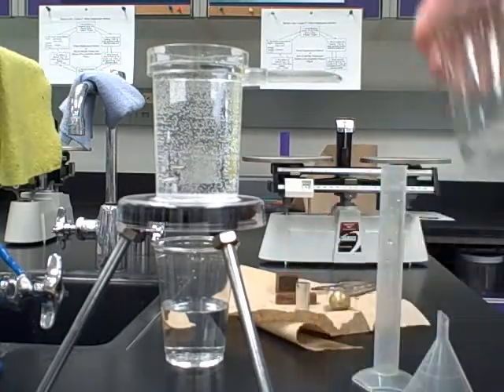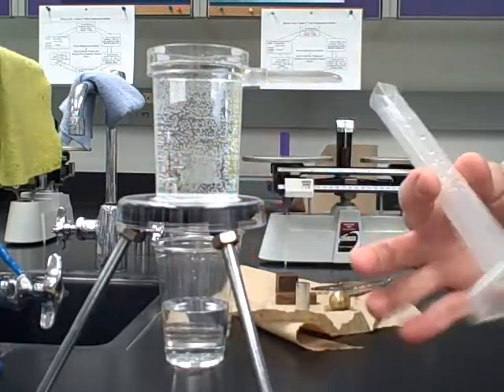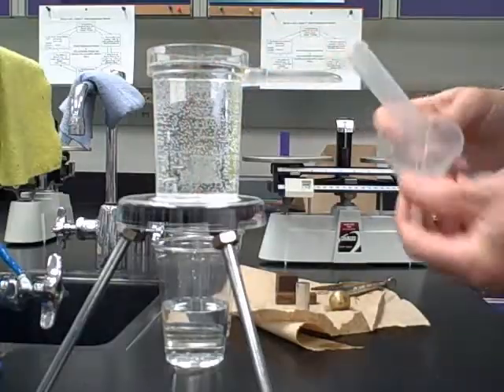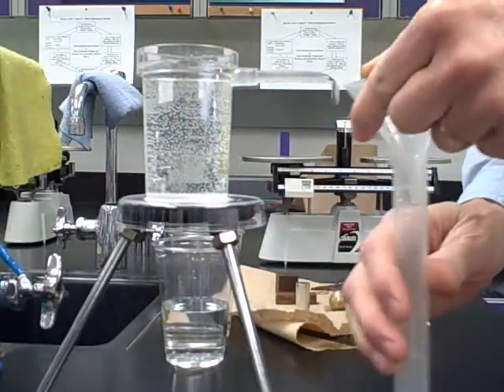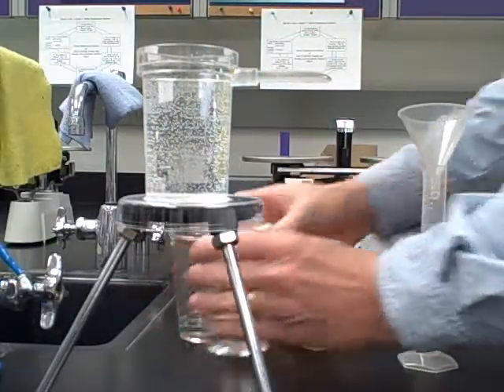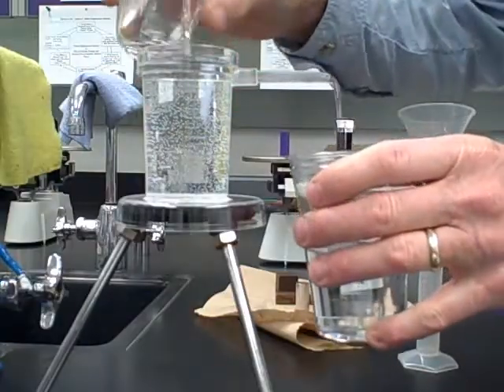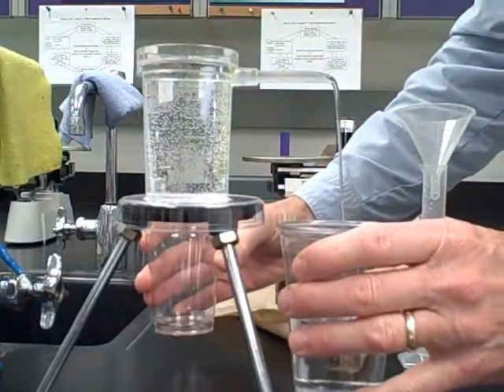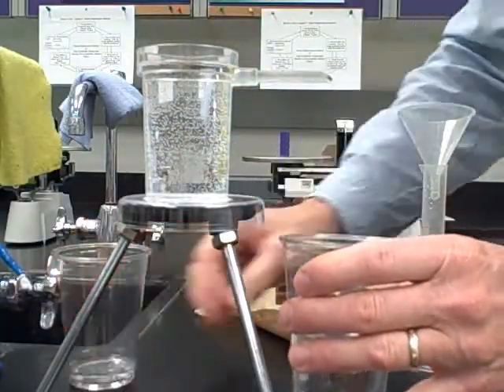We fill it up completely until it stops overflowing, make sure the graduated cylinder's empty, put the funnel on, and if you knock it like that, well then refill it again, because you have to make sure it's totally full each time you go to use it.